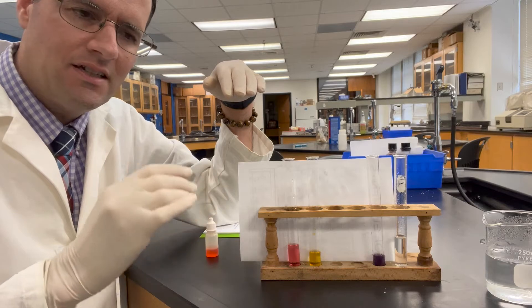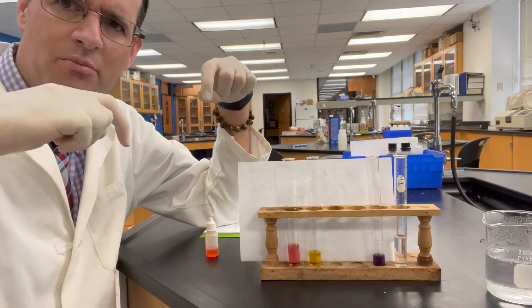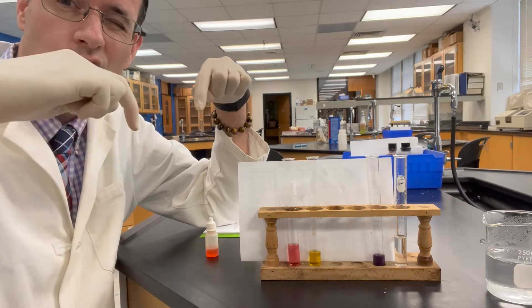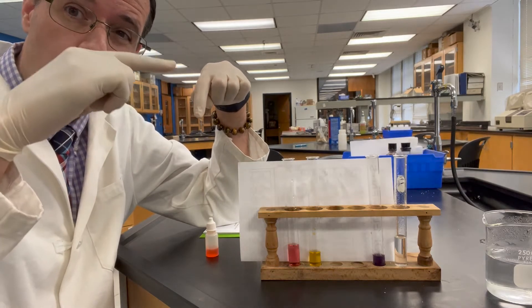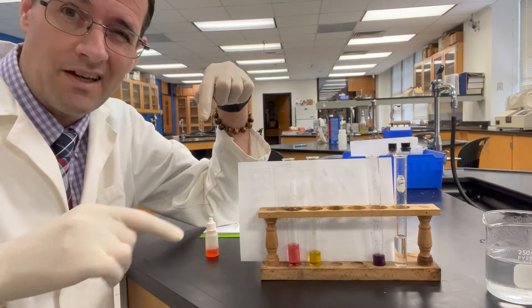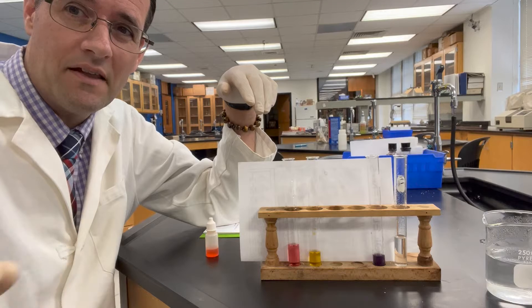It's very hard to see. So at the end, I'm going to place two test tubes side by side — one in cold water, one in hot water — and you should be able to see which tube is more yellow and which is more red: the hot one or the cold one. So just bear with me and let's see how that looks.